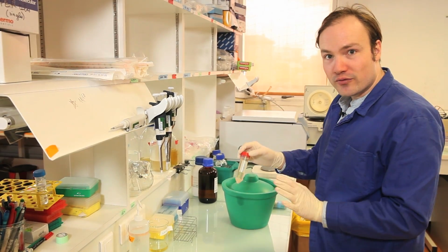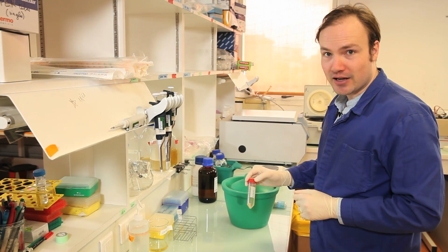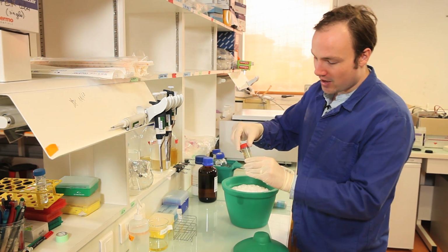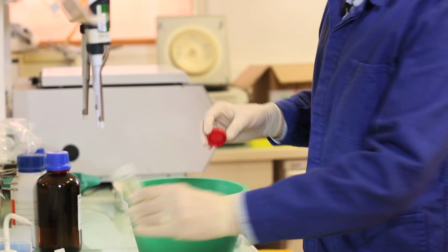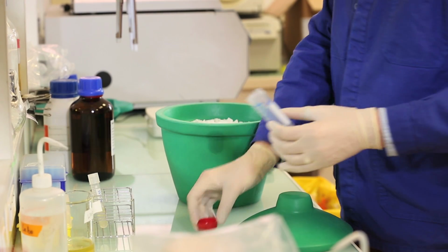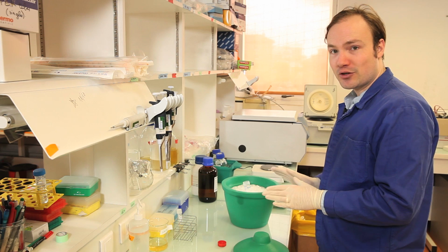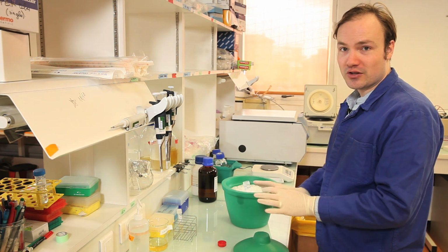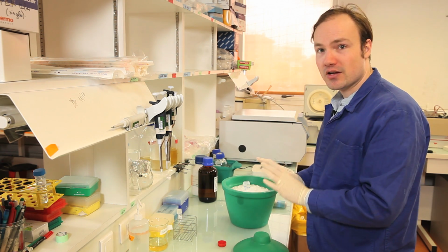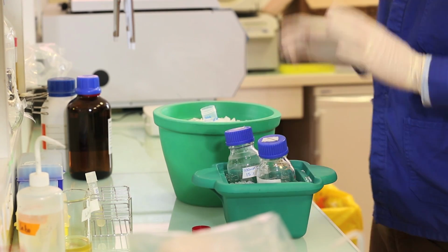Okay, so now we've collected our pelleted cells. Let's turn them into competent cells by adding calcium chloride solution. So the first thing that I'm going to do is very quickly pour off the supernatant from the centrifugation. Store these cells immediately on ice. So from now on, everything that touches these cells should be at 4 degrees Celsius or colder. Now, we're going to resuspend these cells in our calcium chloride solution here, 15 mls.